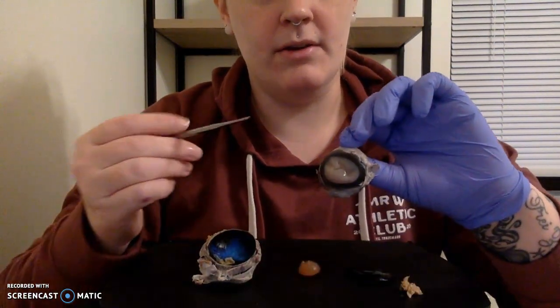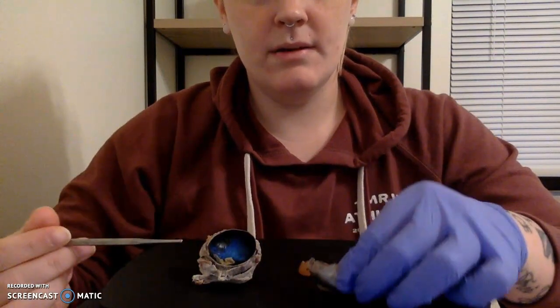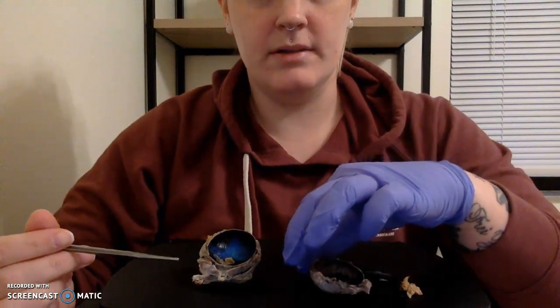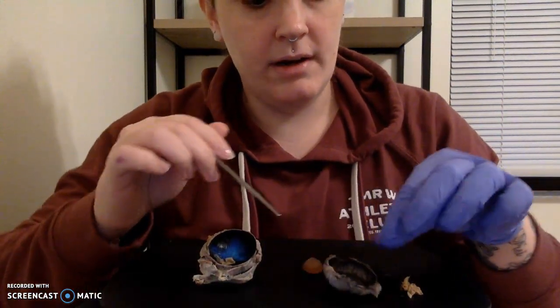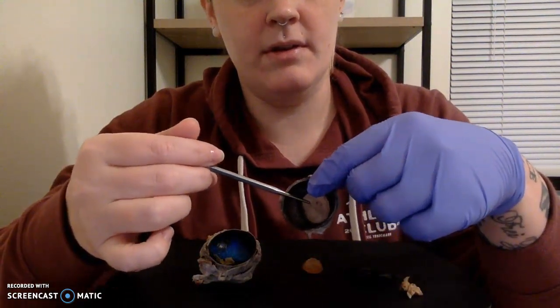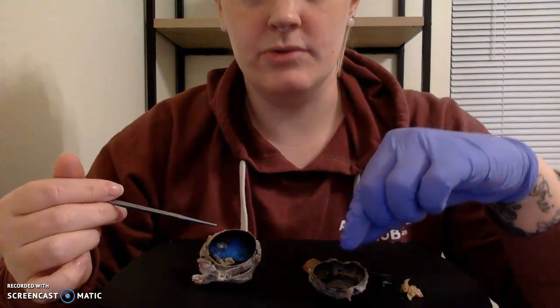which is going to be right here on the surface. The next thing I want to point out is the iris, which is going to be sitting directly on top of our lens. So our iris is still within our chamber here, right here, because it just would not separate and I didn't want to destroy it trying to show you.